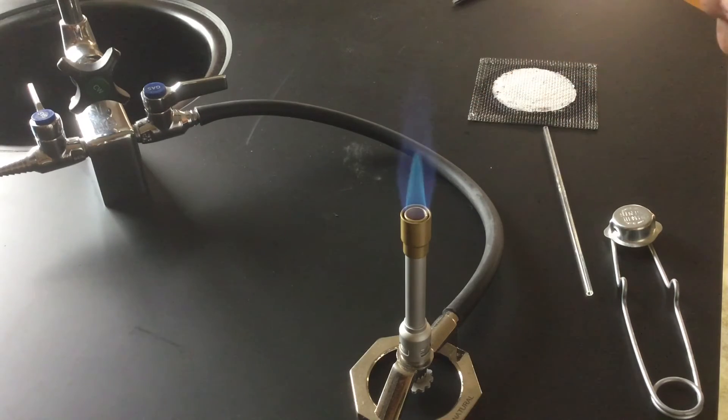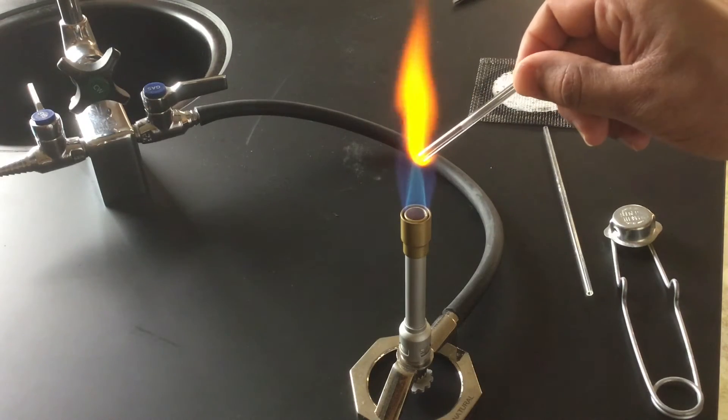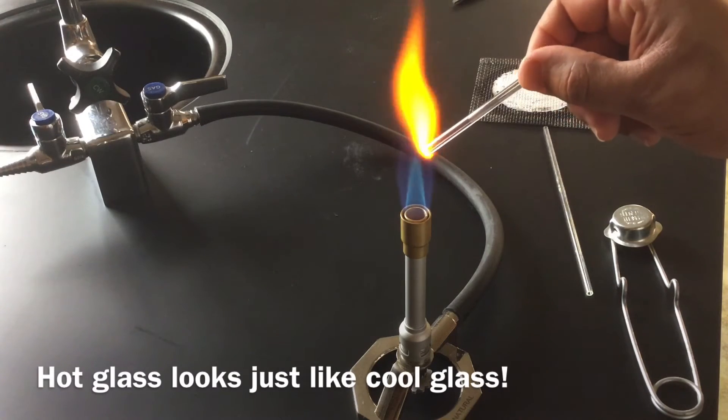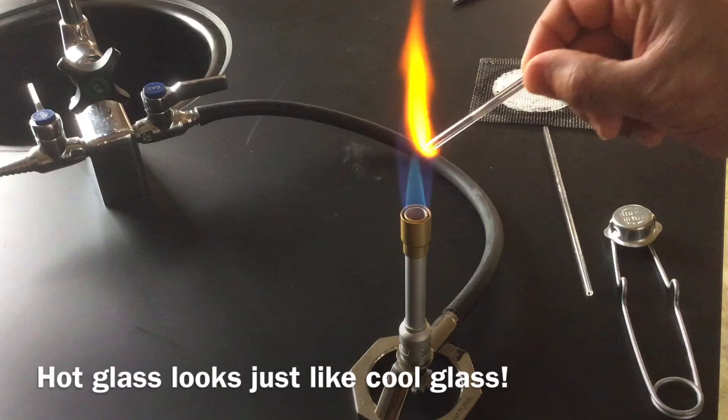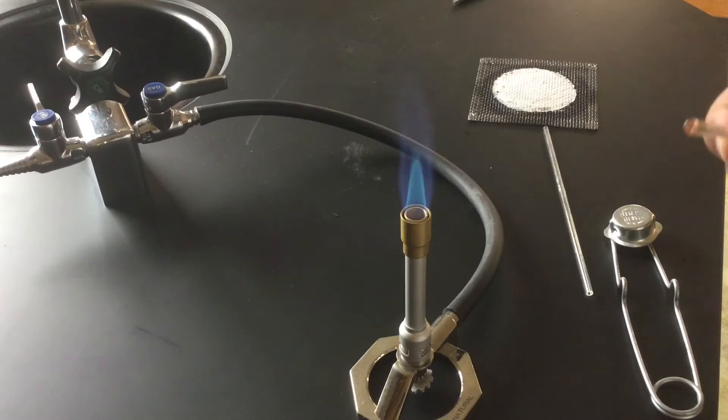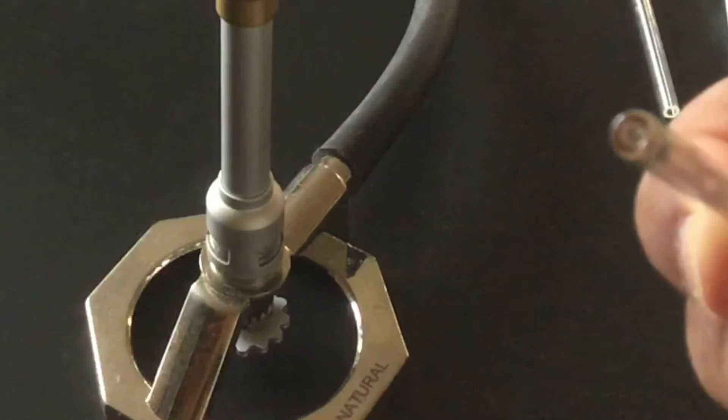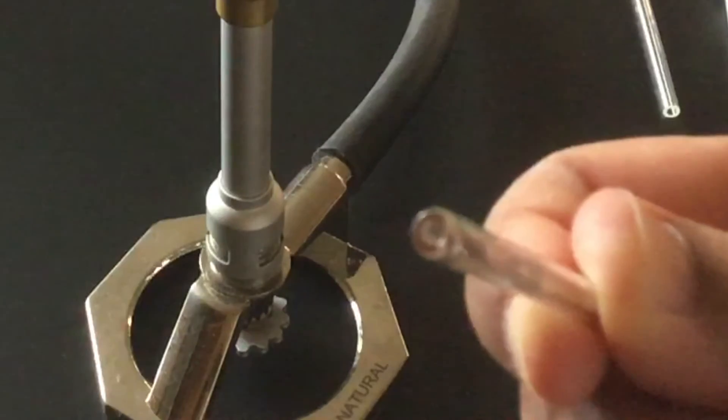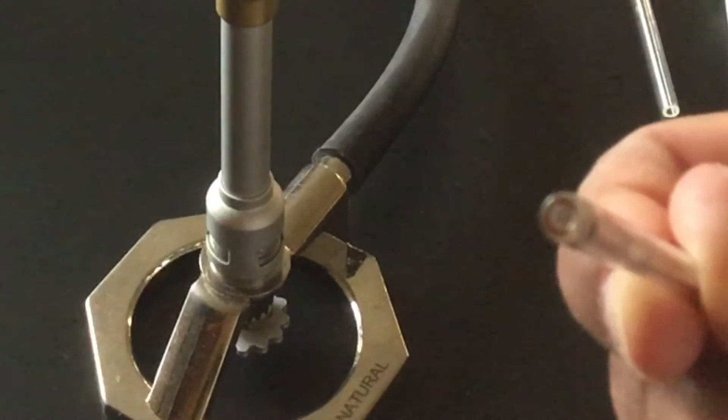Now holding it a little bit more in there. You might notice that the hot glass looks just like cool glass. It's not really glowing red. But now, if I hold this up to the camera, you might be able to notice that the end of that piece of glass is a little bit smoother now. I've smoothed it out.